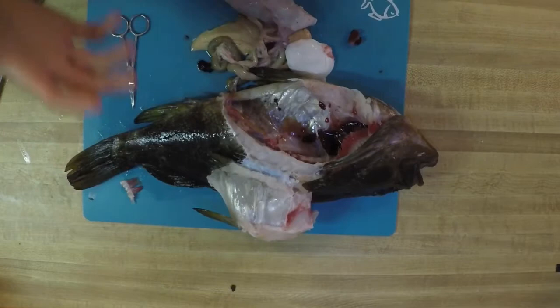Morgan had a really good way of explaining. Think about the environment your fish lives in. With the salt water fish, you are living in a very, very salty environment. The concentration of salt is much higher outside of your body than inside, and salt is going to pull that moisture out of the body of the fish — so it's constantly getting drier and drier. So they are constantly having to uptake more and more water, and that's going to be helping them a lot with their kidney function and keeping them hydrated and healthy. If you're a freshwater fish though, you are actually going to be saltier than your environment — you're constantly absorbing the water you're swimming in because your salt concentration is higher. So that fish is constantly having to be urinating in that water to keep its osmoregulation in balance.